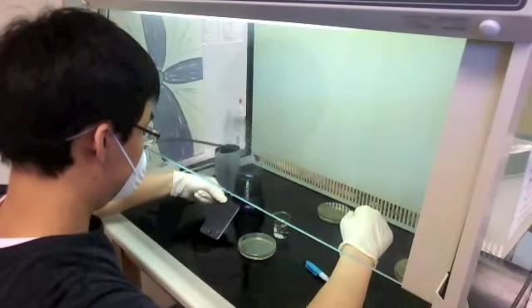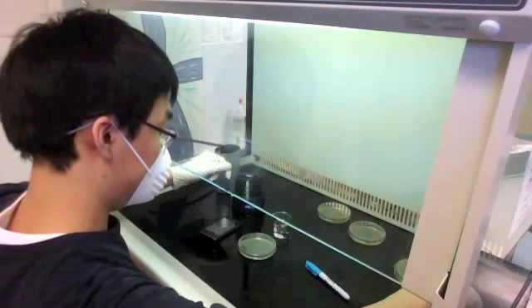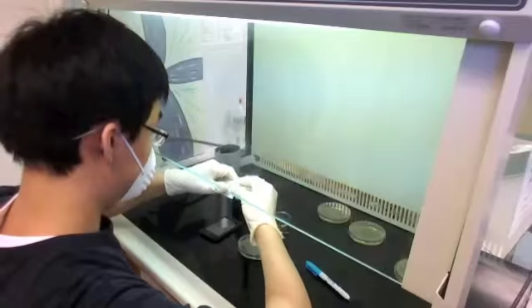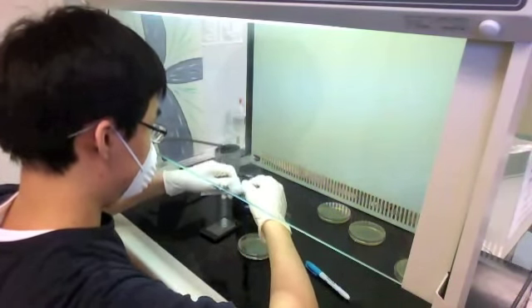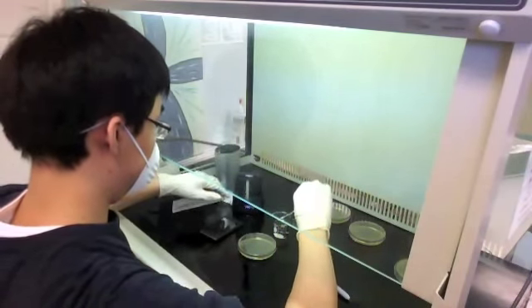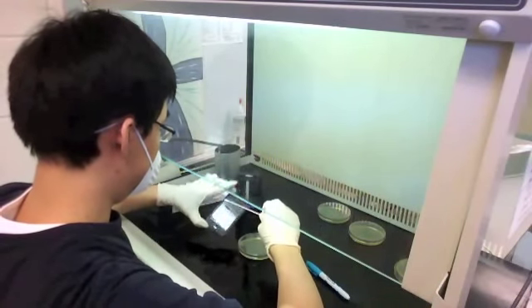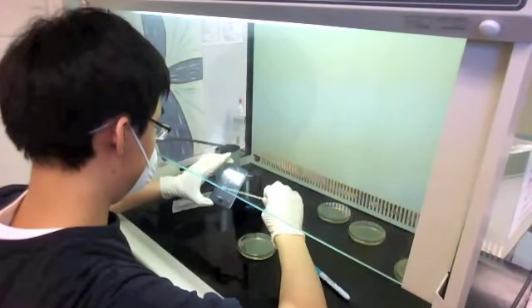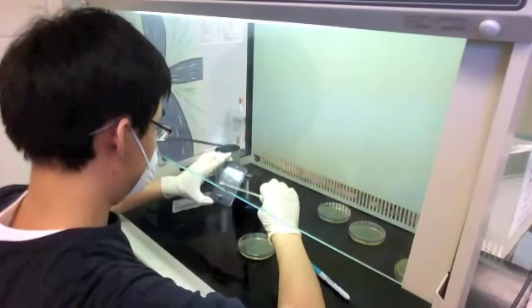Now I'm taking my iPod. I'm a little more generous with touching it because supposedly the UV light inside the sanitizer has killed — not all, but 99.9% of — the bacteria in there. I'm still trying to make as little contact as possible. I purposely aimed the iPod toward the camera to show that this is a different side — not the same side I swabbed for the 'before' plate.